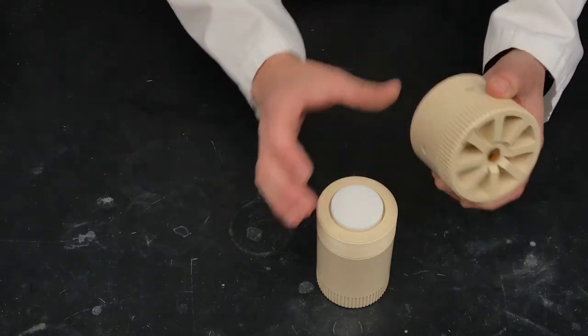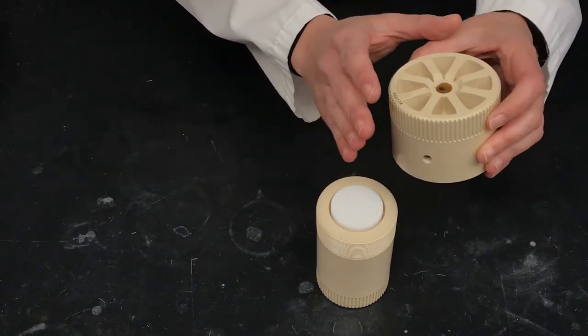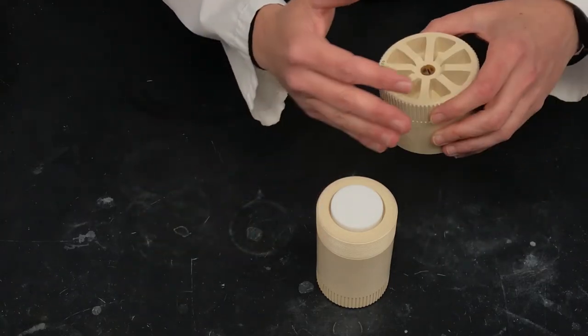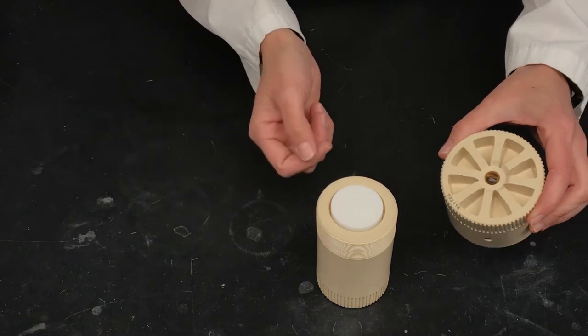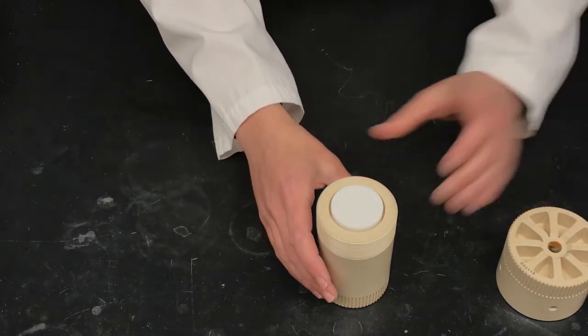This outer cup has some safety features on it that actually prevent it from being damaged or from exploding. One of them is a safety release here.